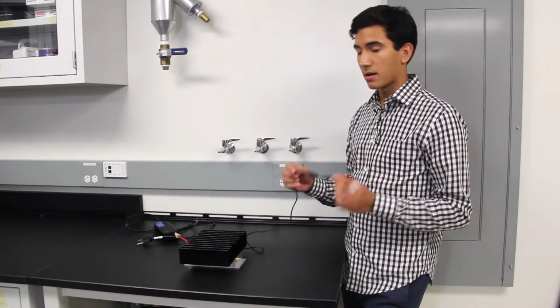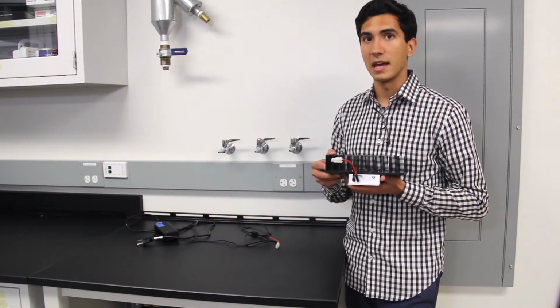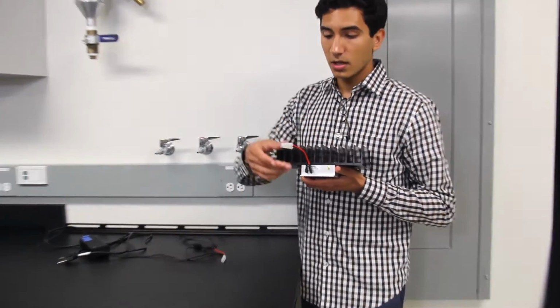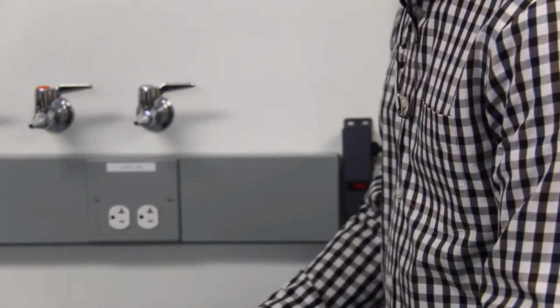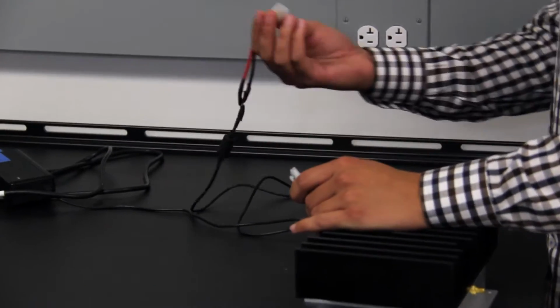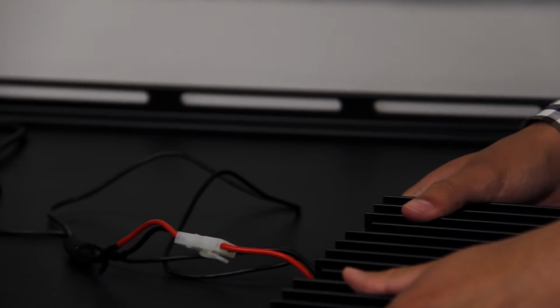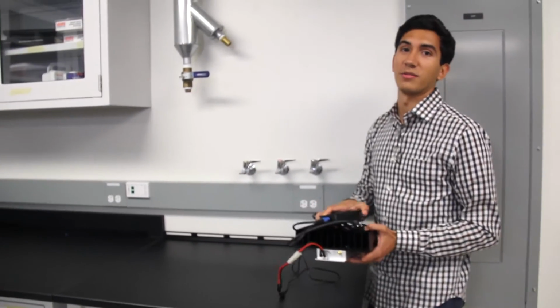Once you've prepared the power adapter, you can move to the power amplifier. On your PA, you'll find connections for power supply and for ground. Solder your other connector to those terminals and then cover those connections in black electrical tape as well. Once you've done both, connect the PA to your power adapter and you should be good to go. I'm going to hand this off to Kevin, and he'll walk you through the next portion.